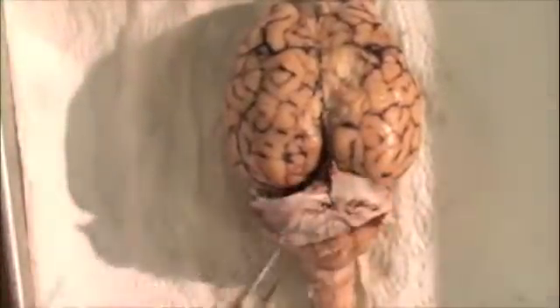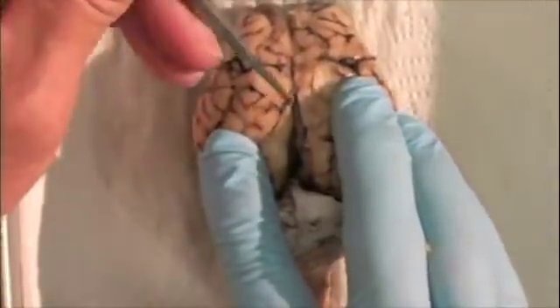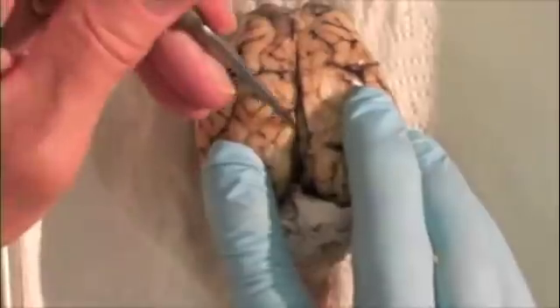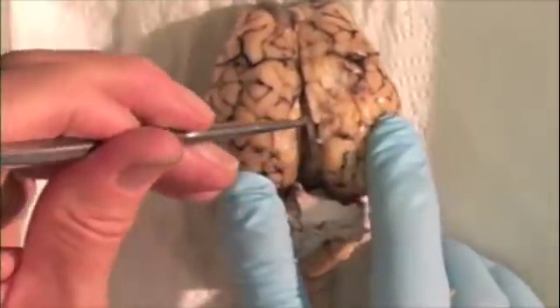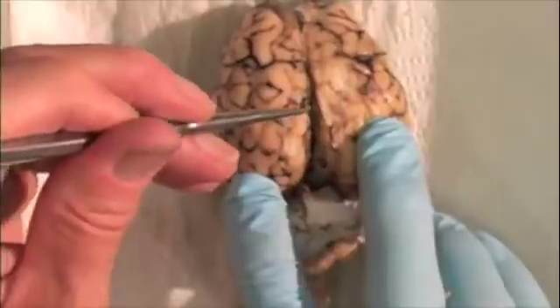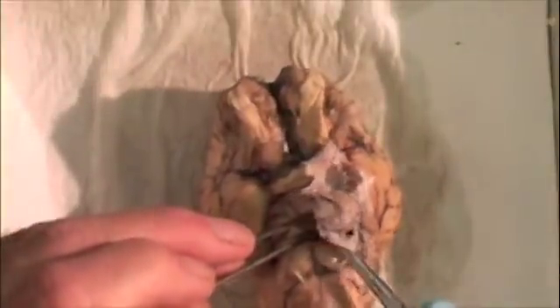On the underside of this part of the dura you can see the tentorium cerebelli. Part of the underside of the dura extends between the two cerebral hemispheres — this is the falx cerebri, not shown in this view. Likewise, it's difficult to remove the portion of the dura found underneath the brain.